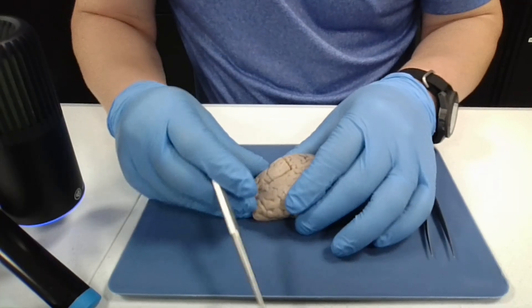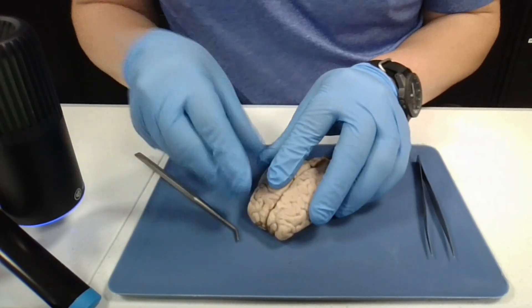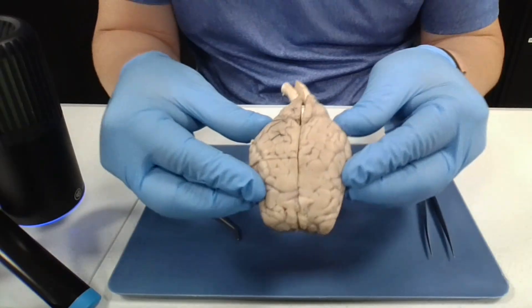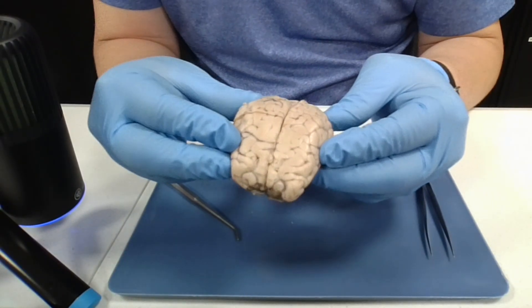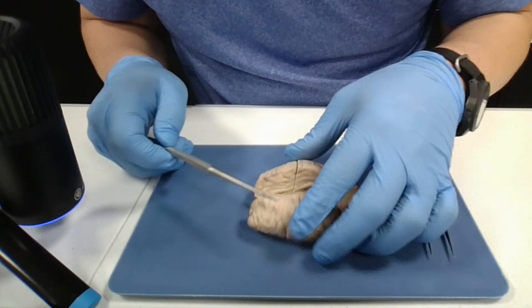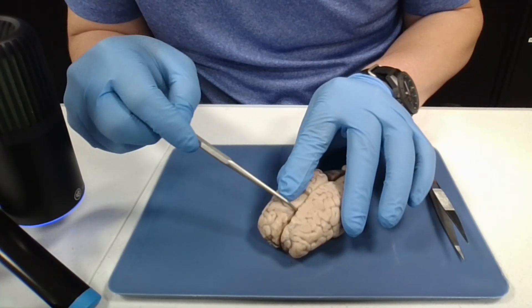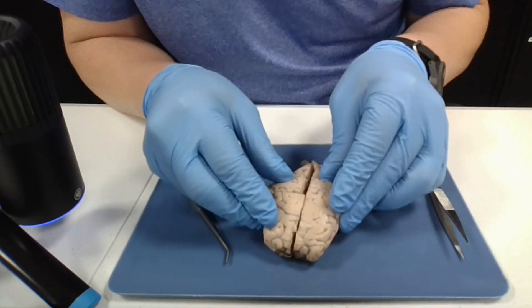Let's talk about the cerebrum — the cerebral cortex. This part here is the biggest part in mammals. If you notice, they have sulci and gyri. Sulci are grooves and the gyri are the ridges. There's a prominent one here. The longitudinal fissure goes down the center here; I cut down that so I could expose the inside.